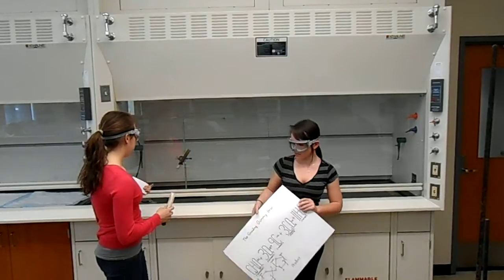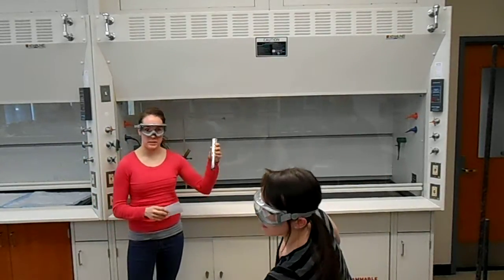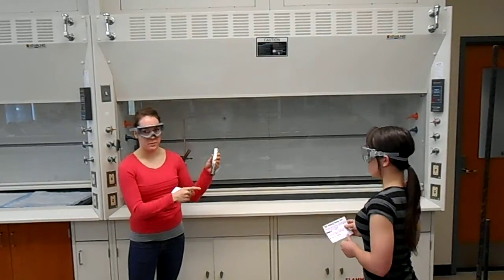As you can see in here, we can't really take it off to show you the carbon, but we already performed an experiment, so you can see the carbon in the bottom is the black that was produced.